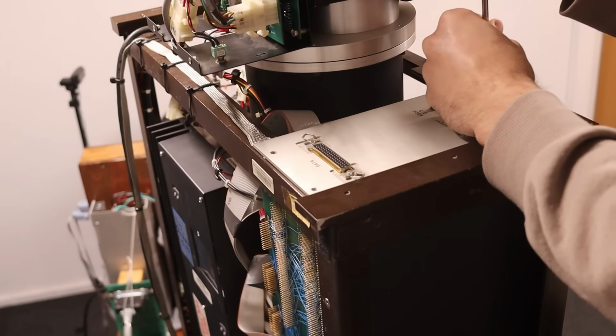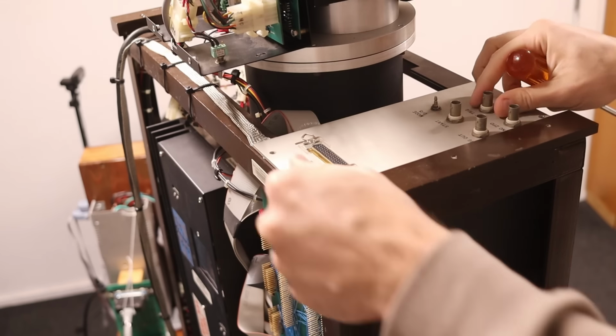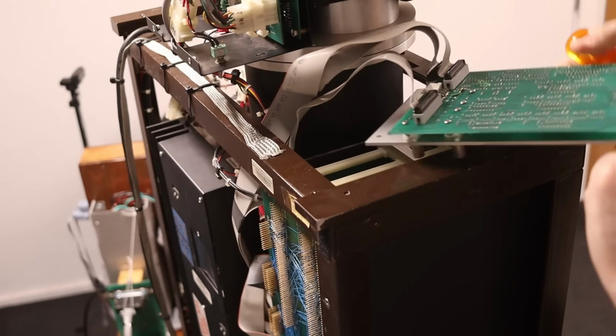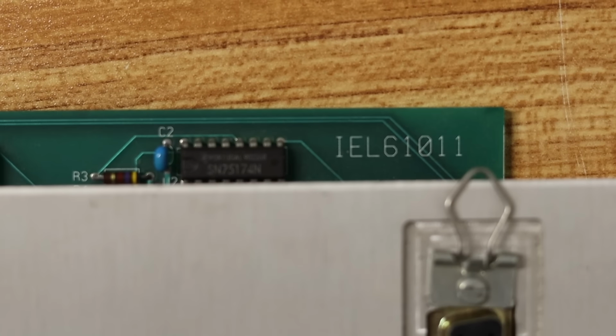Let's pop this board off so I can find a part number on it. It's held in place with just 4 screws, and then we can see that this is the IEL61 revision.